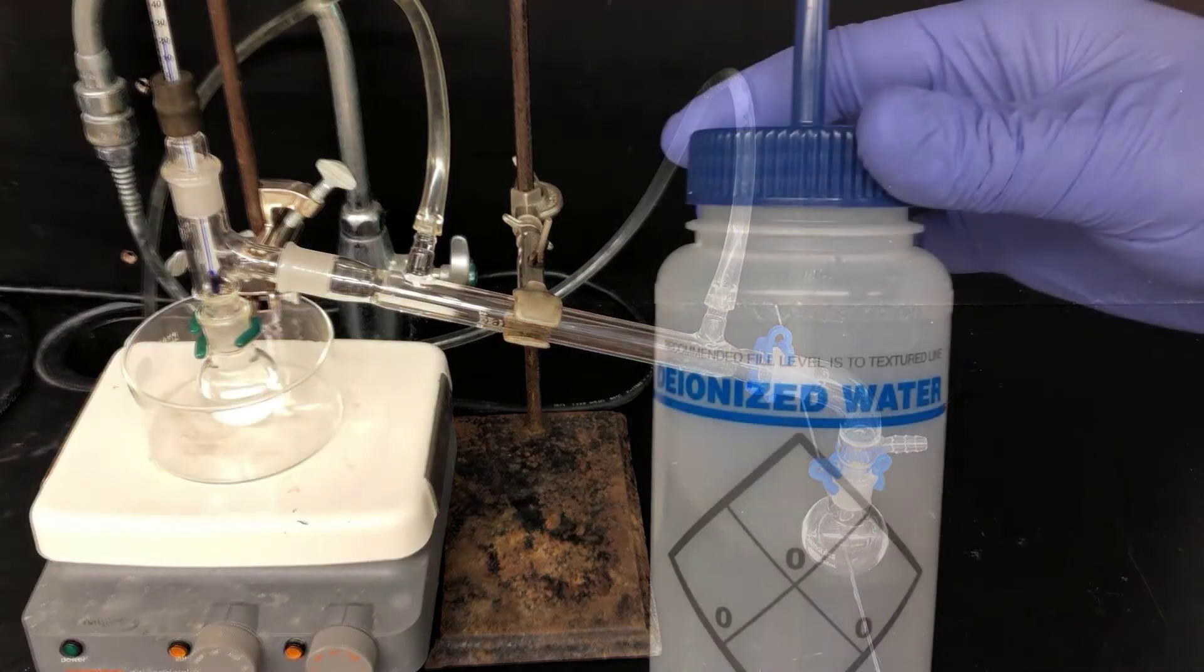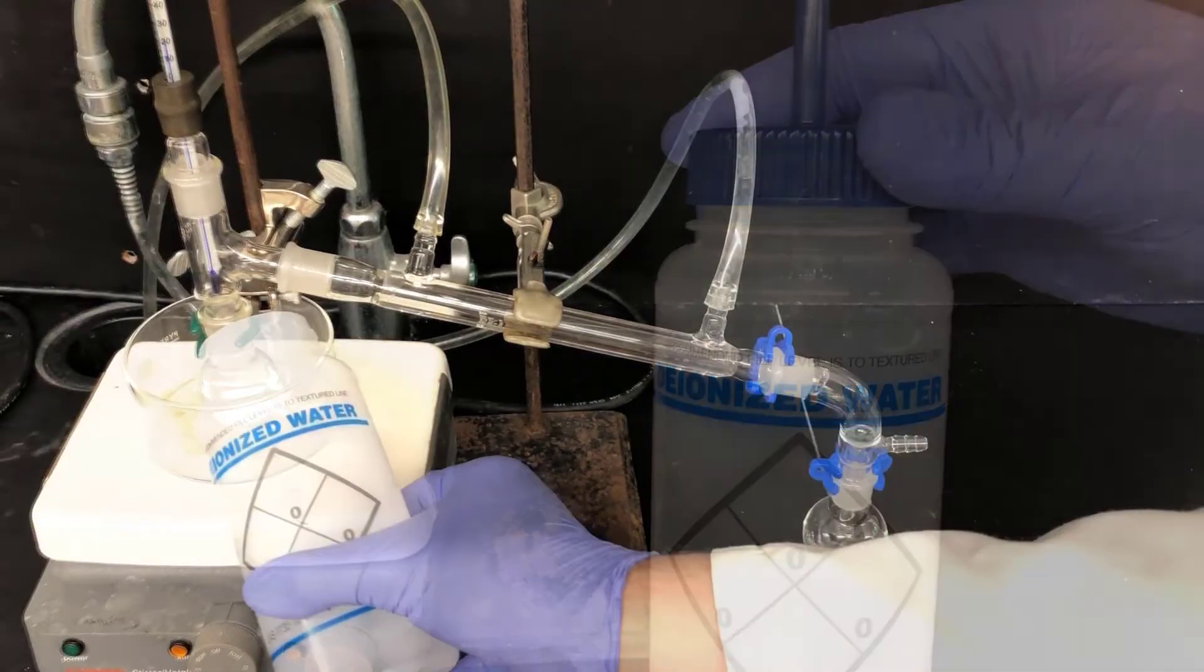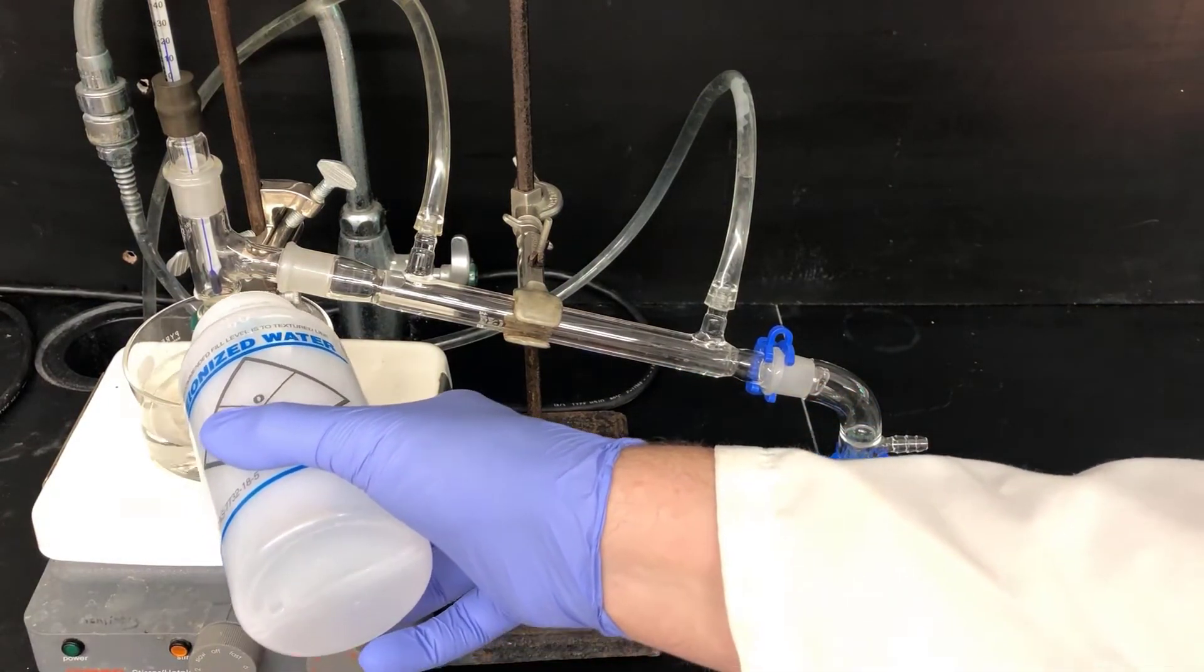Next I'll add water to the bath to serve as a heat transfer medium. Water is a good choice for today's distillation, because boiling water is hot enough to distill all of the unknown solvents, but none of the unknown solutes.